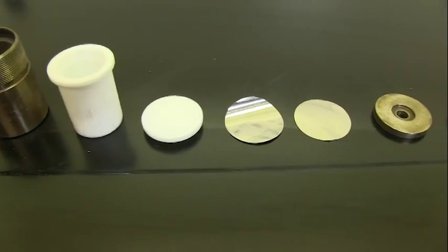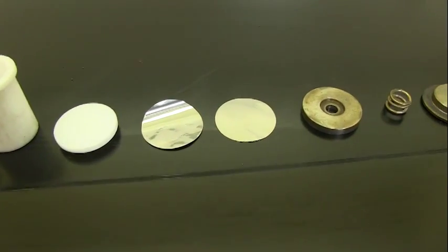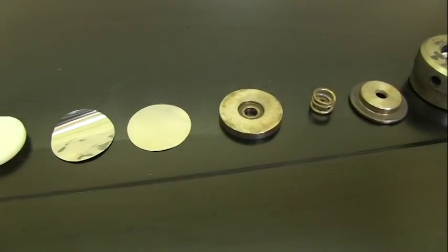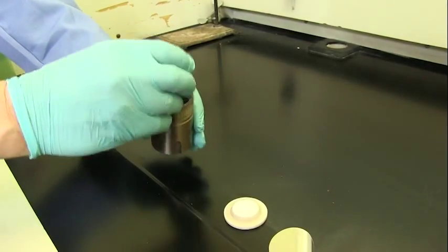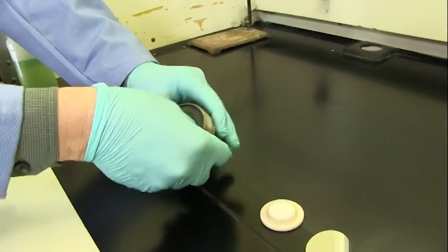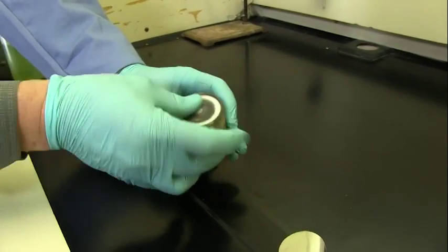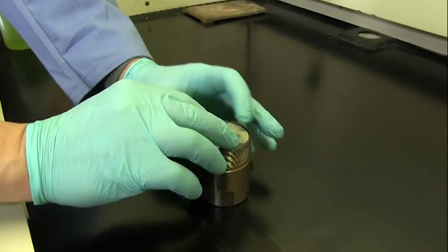Store all the parts of a vessel together to avoid mismatches. Due to PTFE flow, once a PTFE cup and lid is pressurized, it becomes a uniquely matching pair. Using unmatched pairs of cups and lids will cause leaks.